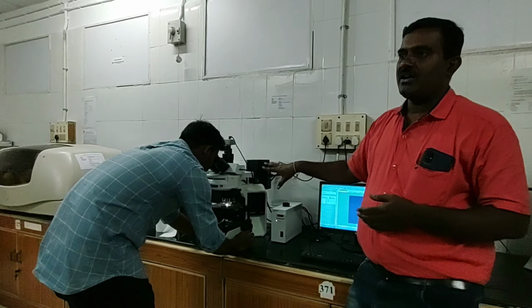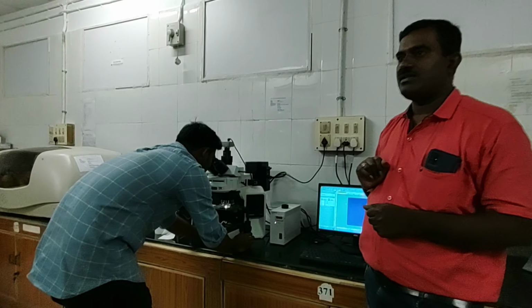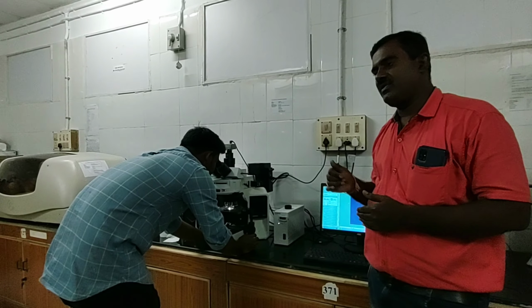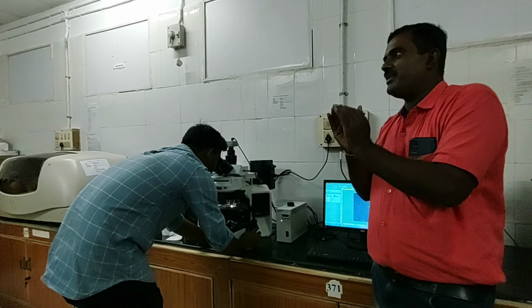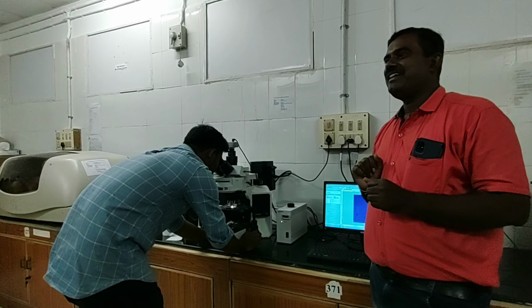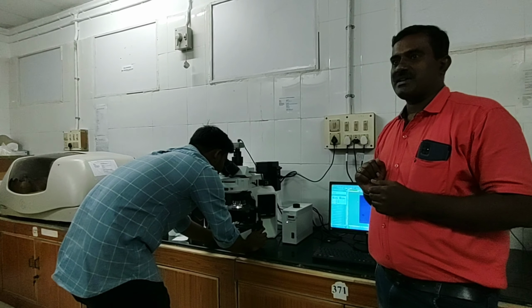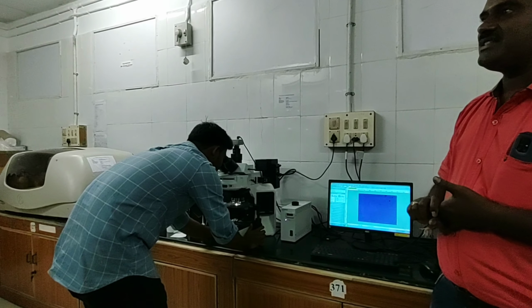And today you can watch with this the chromosomal abnormalities, that is like karyotyping. She will come in the afternoon and take it. I am not an expert with this, I just tried only a small bit. Only a pathologist has to get expertise. And madam also does cancer cytogenetics. She is coming. She will take care. Just two days back we also tried this.